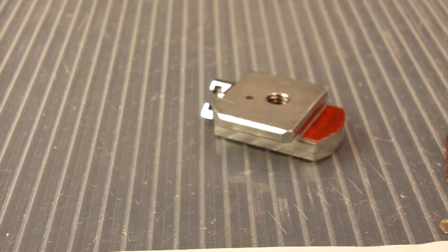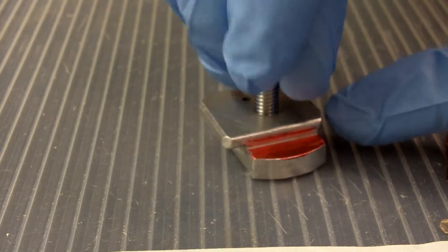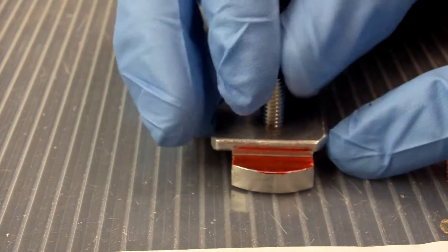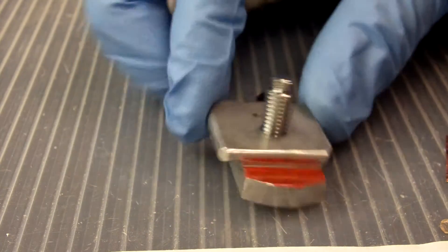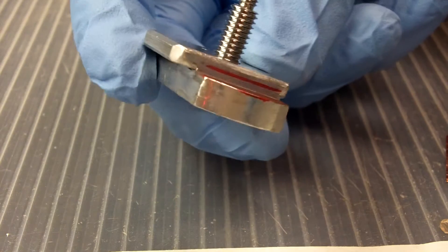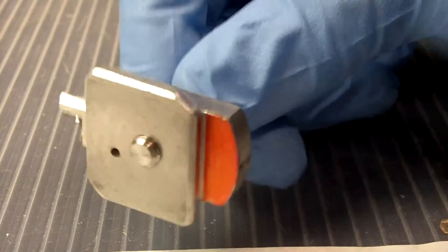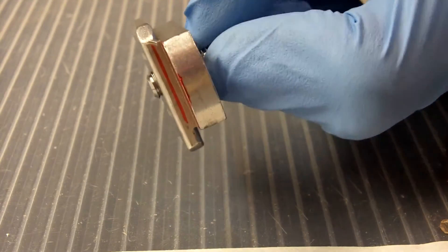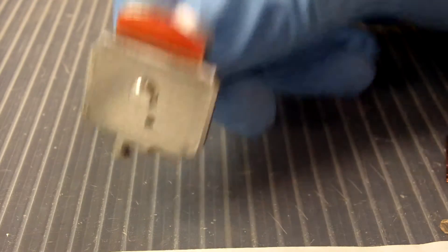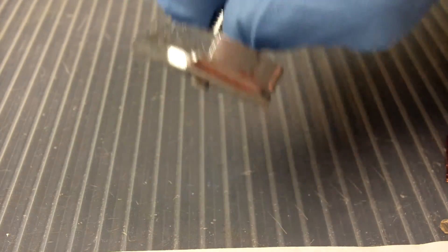Well, people would start off by screwing the screw in from the wrong side, which of course would be disastrous since the sample holder would then get stuck inside the microscope. The second problem would be that people would screw the screw in from the top too far and then have the screw stick out the bottom of the base. Of course, also getting the sample stuck inside the microscope. Disastrous!